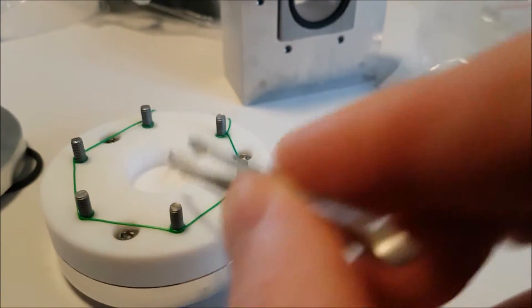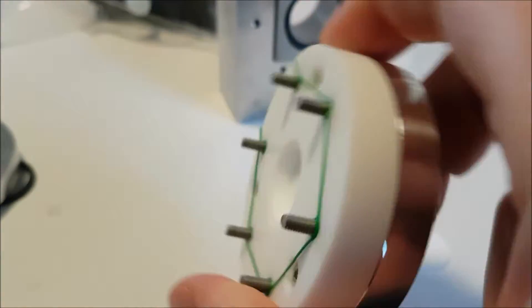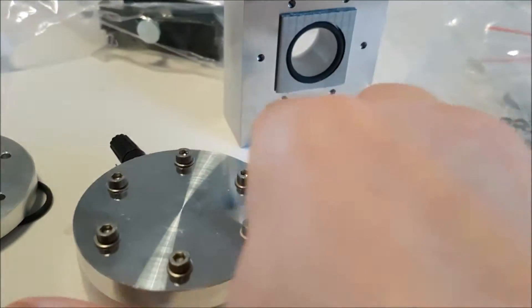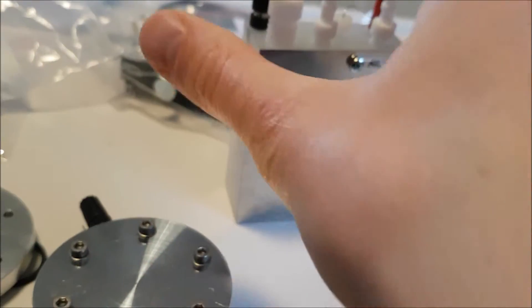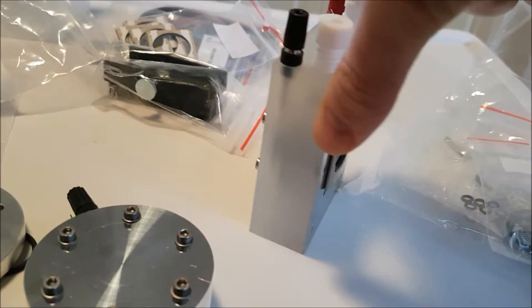yeah you're right. There's another disc which also goes straight on the back, it's beautiful. That'll go on the back so you'll be able to see the whole thing from this side.